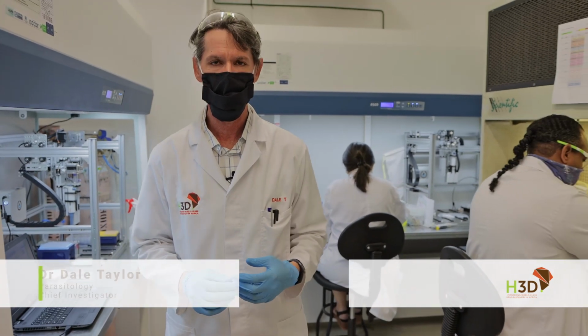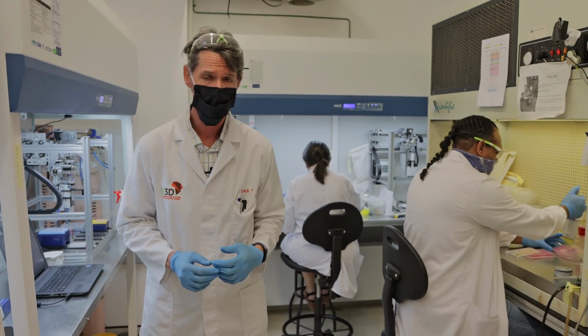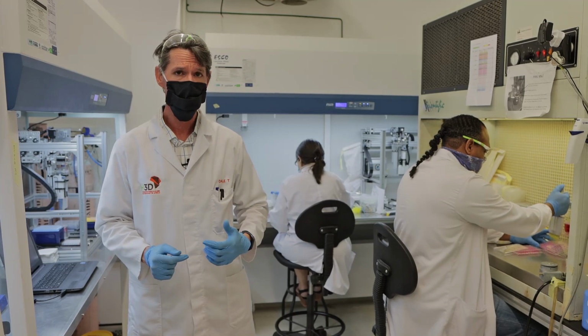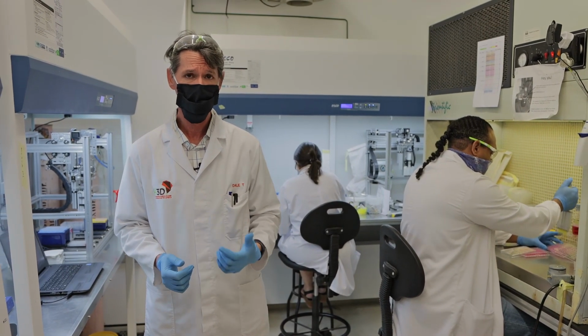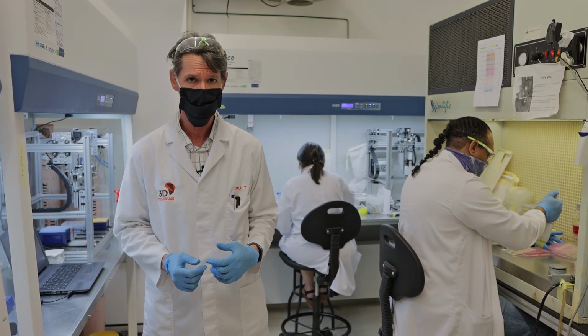Hi, I'm Dale. I look after H3D's Malaria Biology Lab. Welcome to the operation. Here at Malaria Biology, our primary role is to make sure that all of the new drugs which are produced at UCT chemistry are actually active against the human malaria parasite.